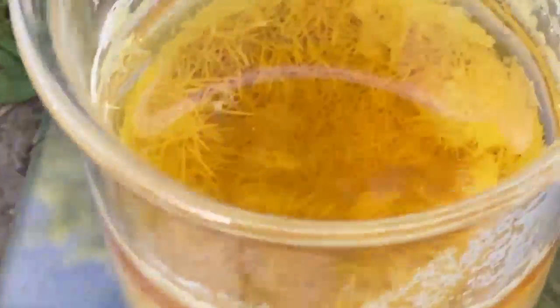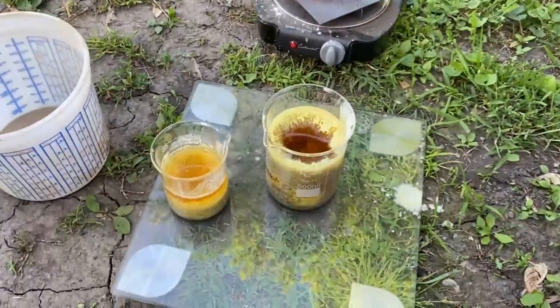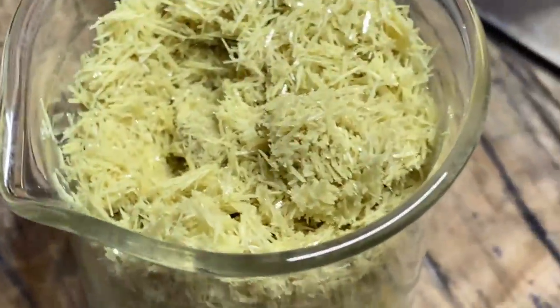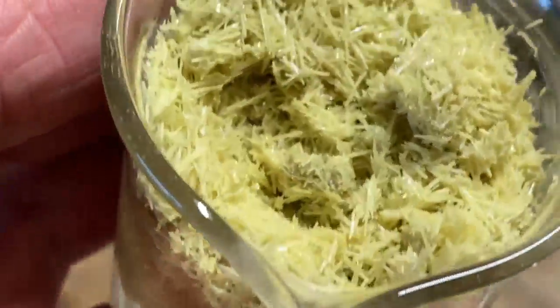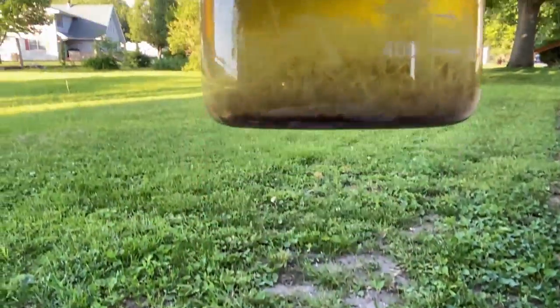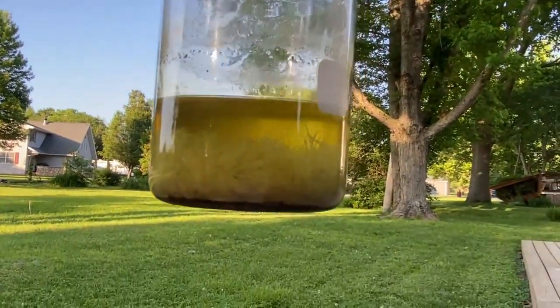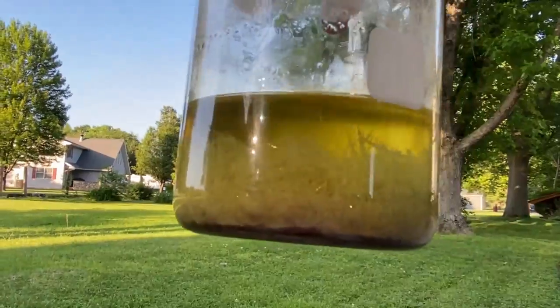This is what we came up with after about an hour. I'm going to decant this. So this was the cleaner portion — it was scraped off the top and I'll recrystallize it by itself. And this is the dirtier portion, which is still probably just fine for smoke bomb grade sulfur. This stuff here is looking a lot more agreeable, but it's still got that muck layer on the bottom, so we're going to avoid that muck layer at all costs on this particular extraction.